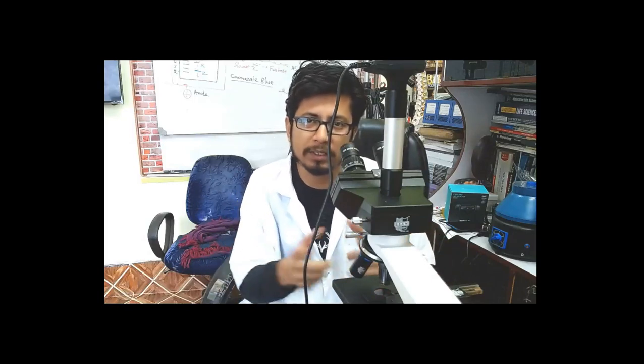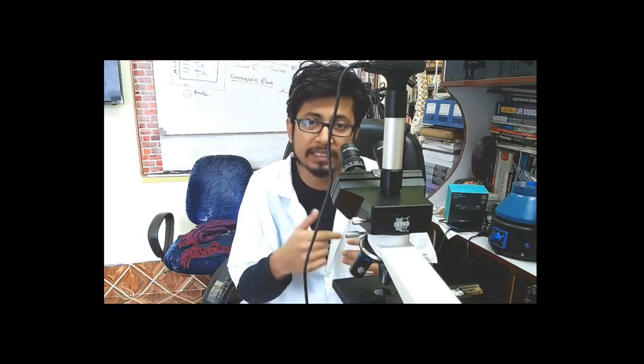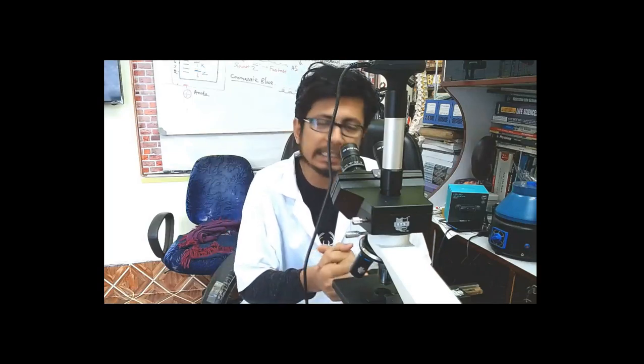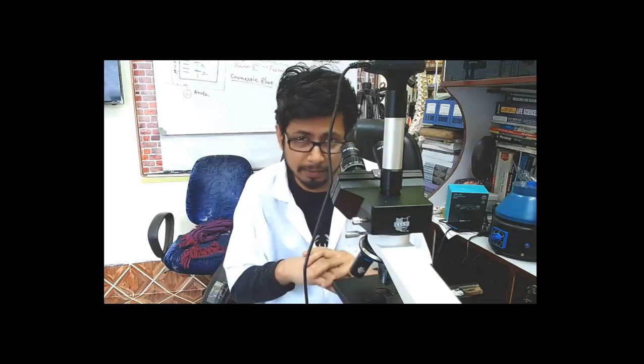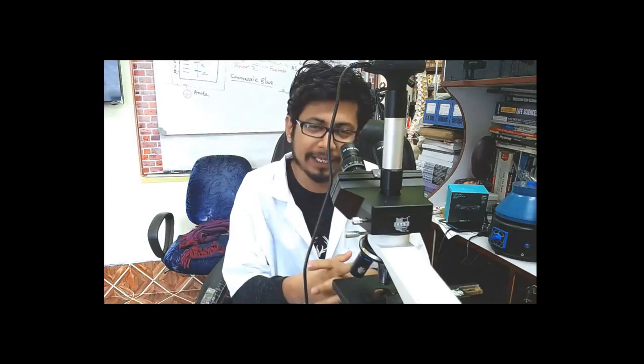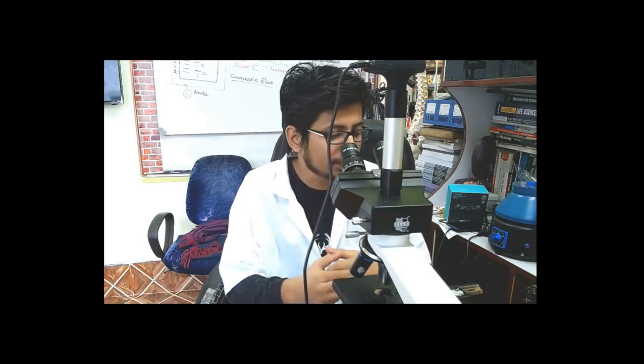All the different phases of mitosis — prophase, metaphase, anaphase, telophase — and the separation of the sister cells from each other. It's wonderful to see under a microscope. I cannot show you that live, but I can show you the stages with the help of onion root tips. I already have prepared the onion root tip; the roots are there.